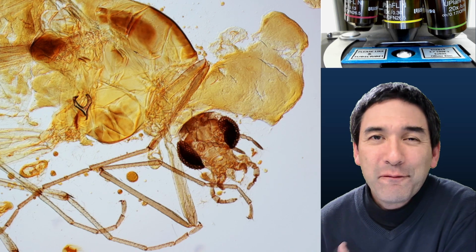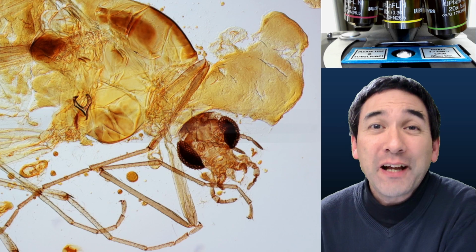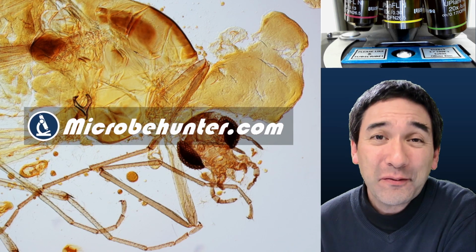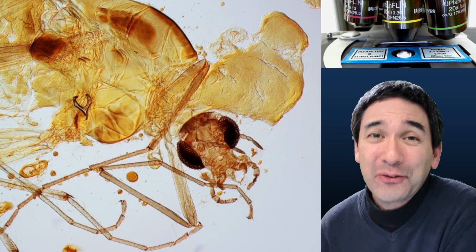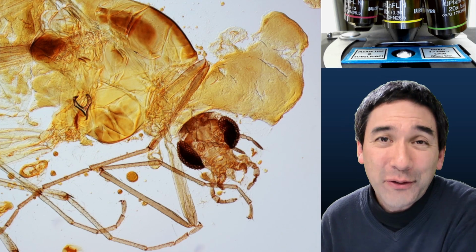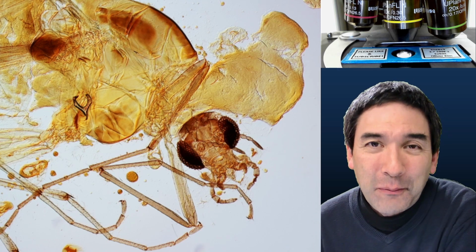So this here is my very first microscope slide that I prepared in the year 1998. So almost 25 years ago as of the making of this film. And it's a pretty bad slide. And in this video today, I'd like to give you 3 recommendations so that you do not have to repeat the mistakes that I made when preparing microscope slides.